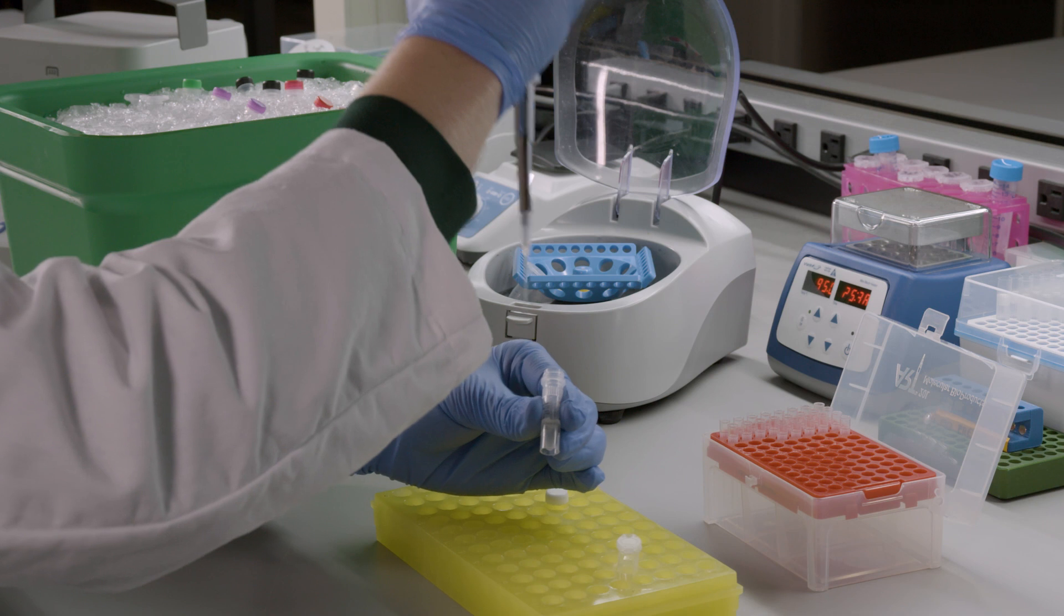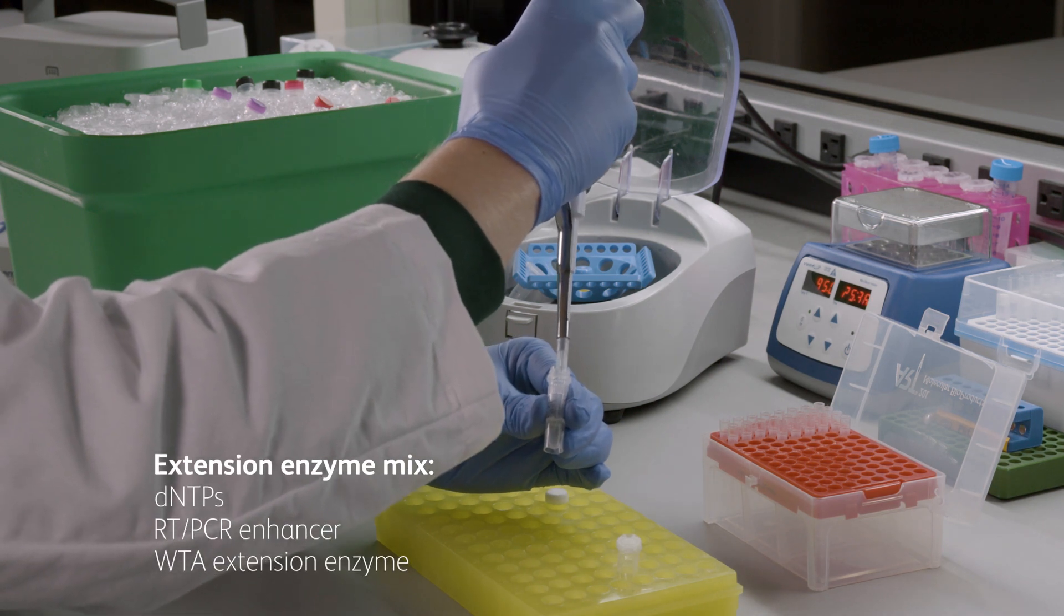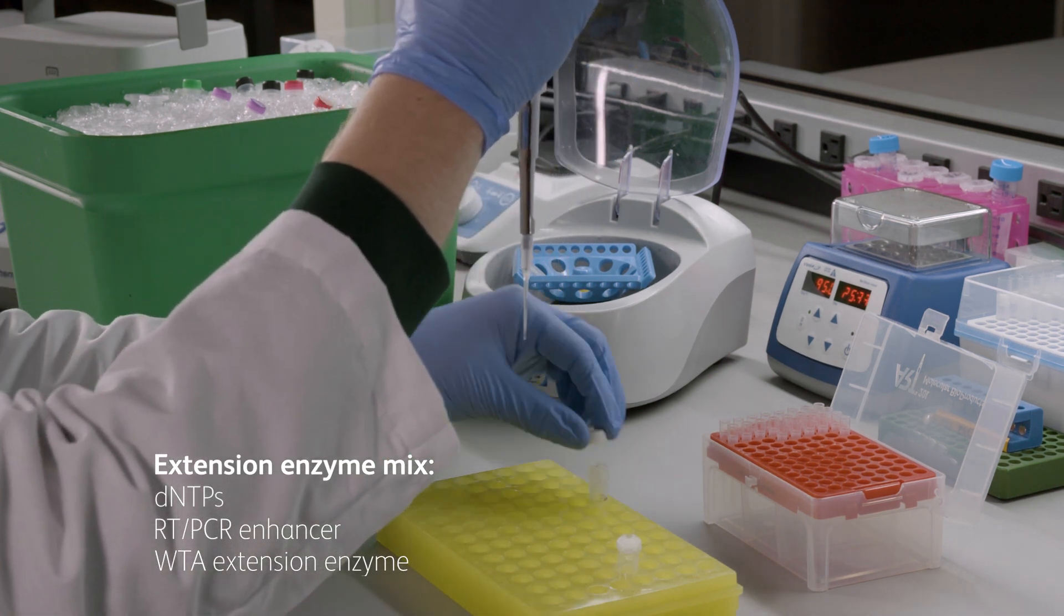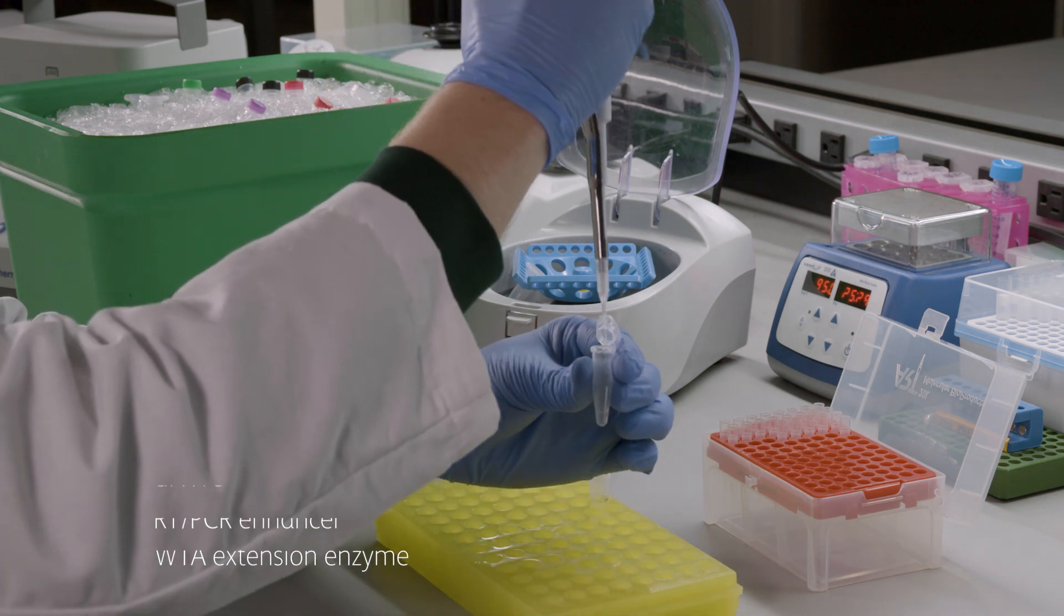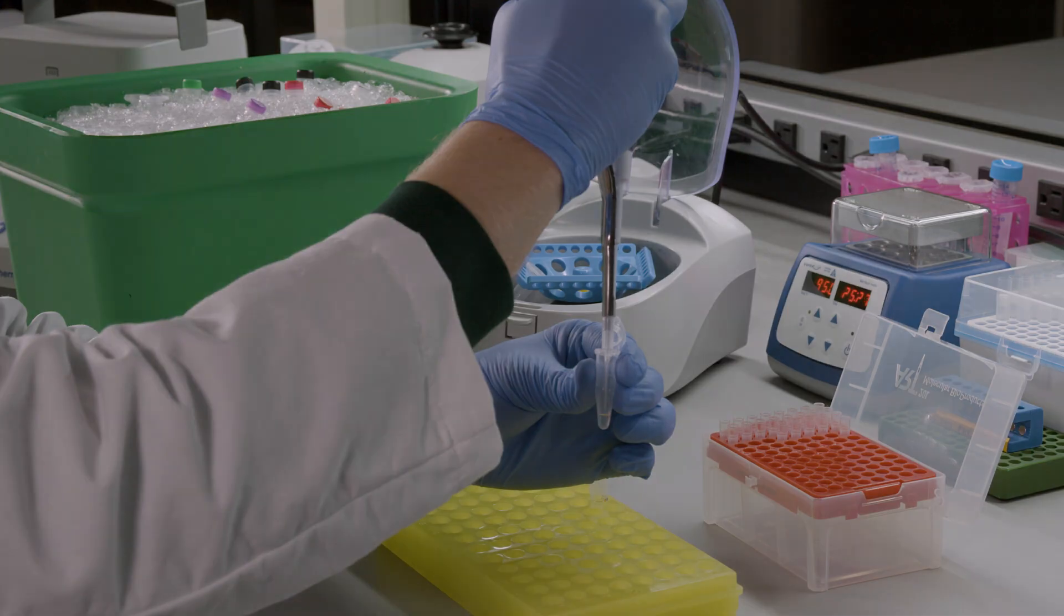During the incubation, prepare the extension enzyme mix by combining dNTPs, the RT-PCR enhancer, and the WTA extension enzyme together. Pipette mix and place on ice until needed.